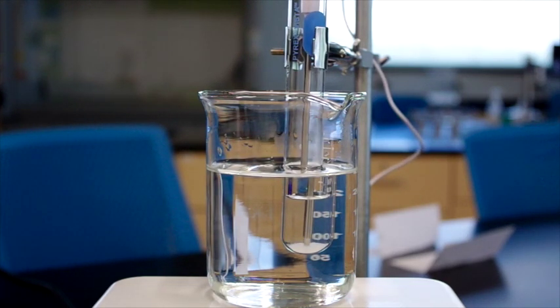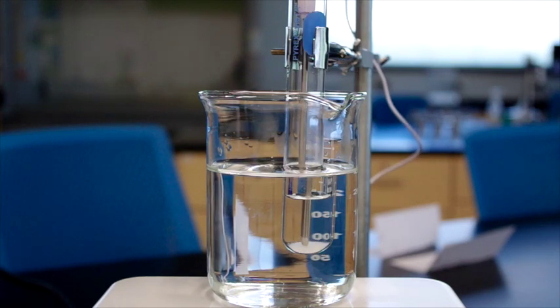We're now around 35 degrees Celsius. But the relevant temperature measurement will not come until we have fully dissolved all of the potassium nitrate, and then take it off of the heat and allow it to cool until potassium nitrate begins to recrystallize. The temperature at which recrystallization occurs is the relevant temperature for this experiment.